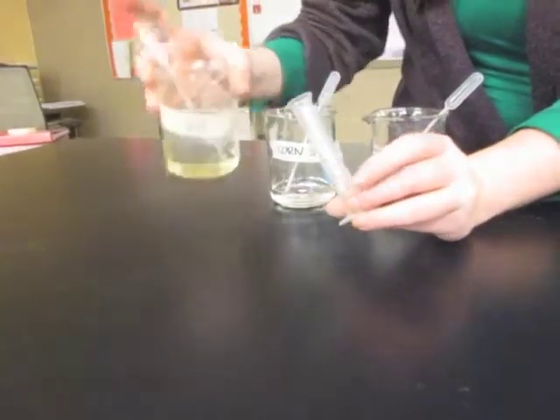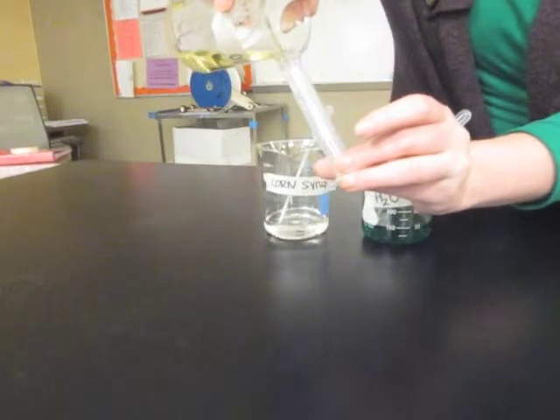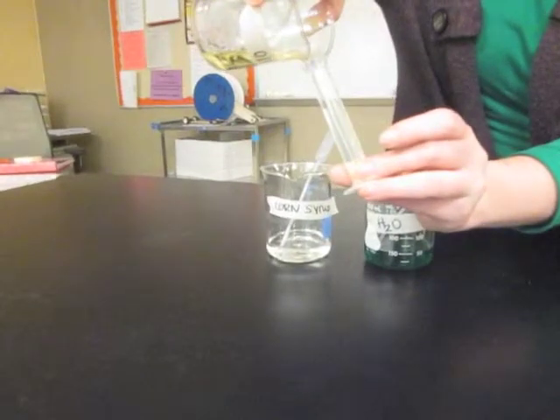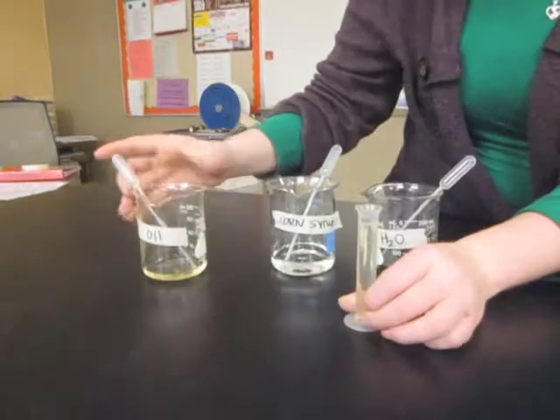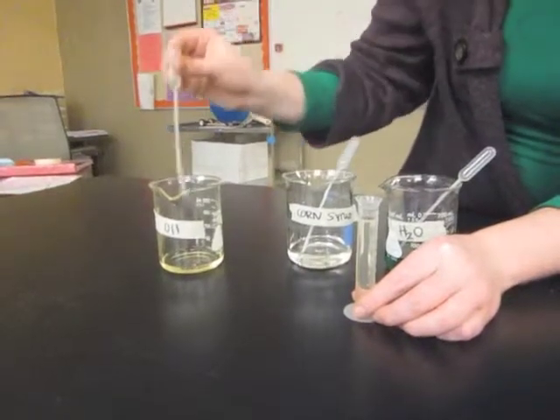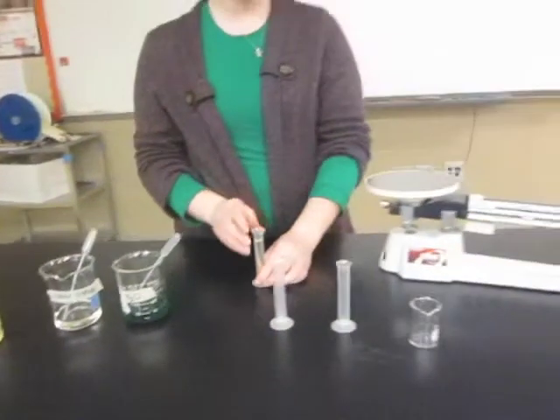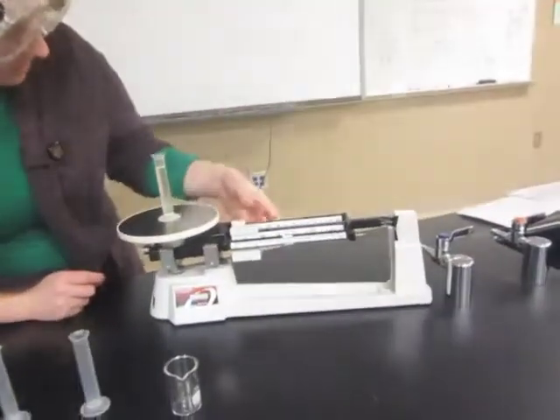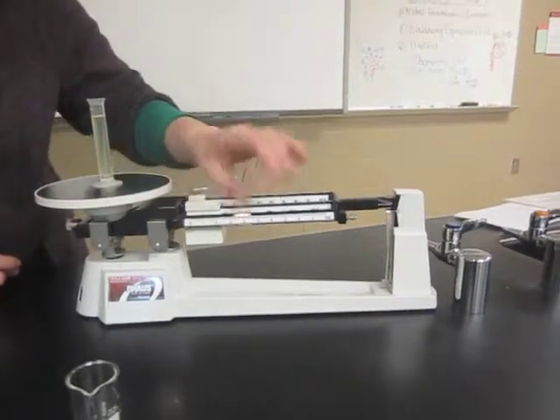I'm going to fill it to the 10 milliliter line with oil. Sometimes it does work better just to pour the oil into the graduated cylinder. If you do go over, you can use your pipette to remove the extra. Now, since we want the mass of just the oil, we need to weigh it again and subtract the final mass from your initial mass of your empty graduated cylinder.